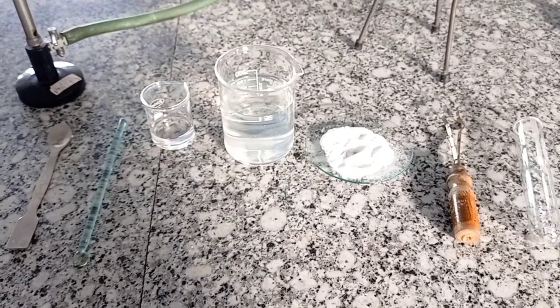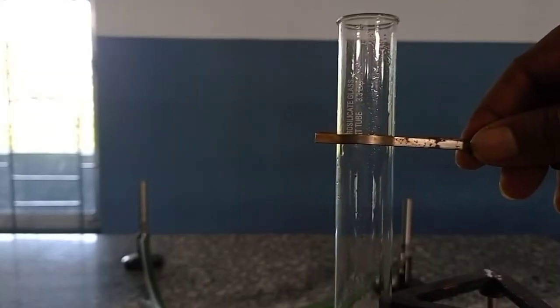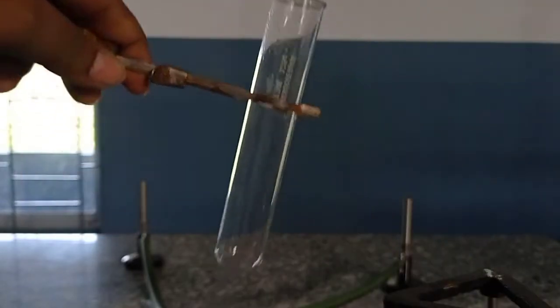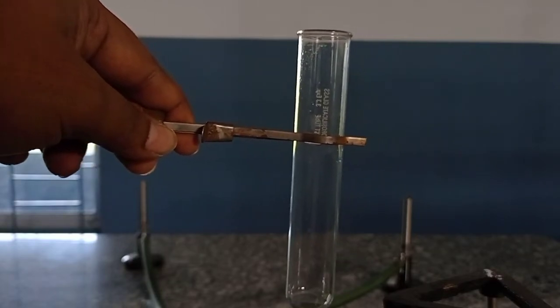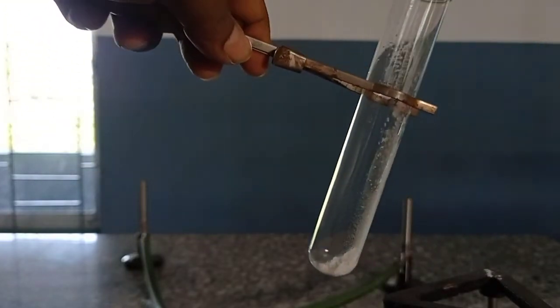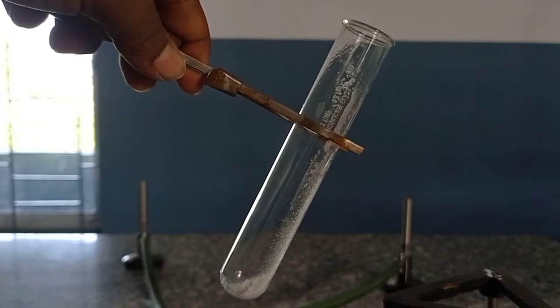Now let us move on to the demonstration. First, I will take a clean test tube and attach it to our test tube holder like this. After this, with the help of a spatula, I will add a little amount of sodium bicarbonate salt into the test tube.